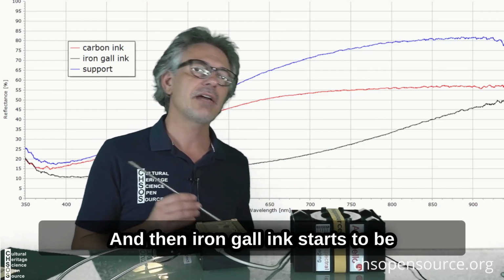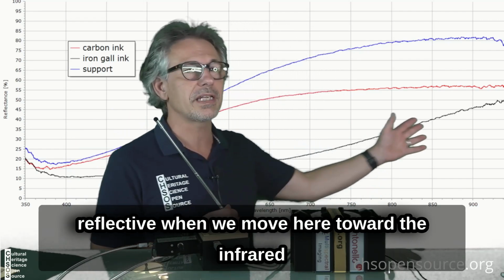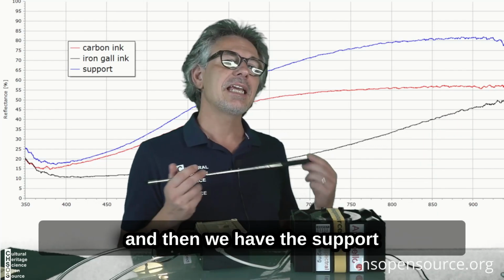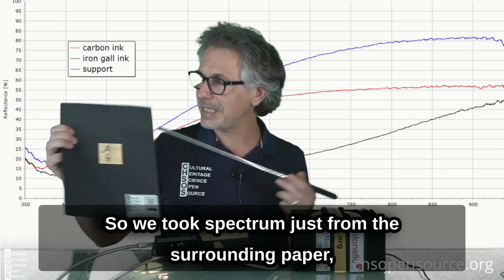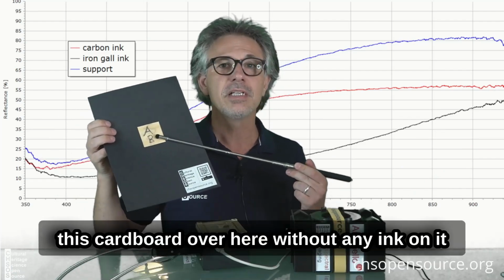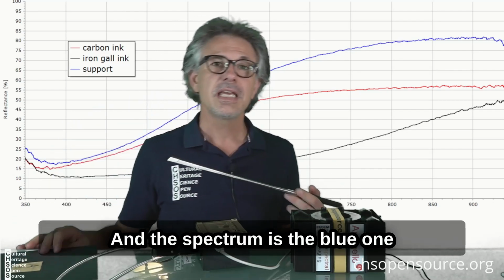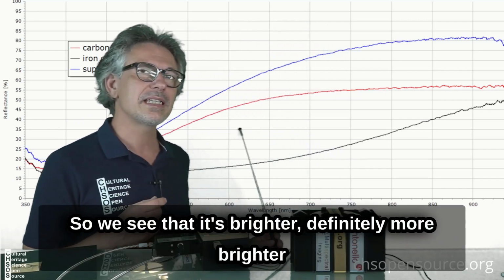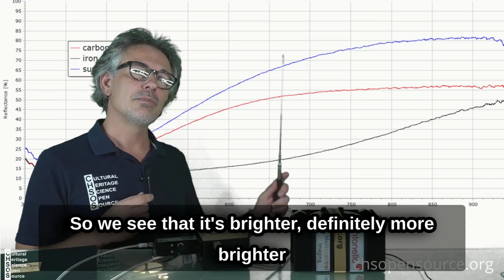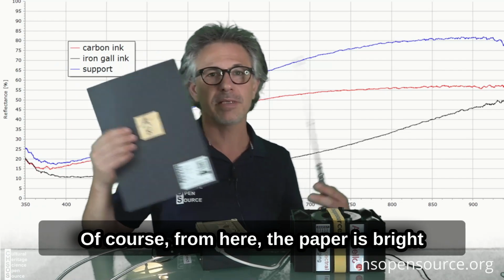And then iron gall ink starts to be reflective when we move here toward the infrared. And then we have the support, so we took a spectrum just from the surrounding paper, this cardboard over here without any ink on it, and the spectrum is the blue one, so we see that it is definitely brighter than the other ones, as we can tell of course from here, the paper is brighter.